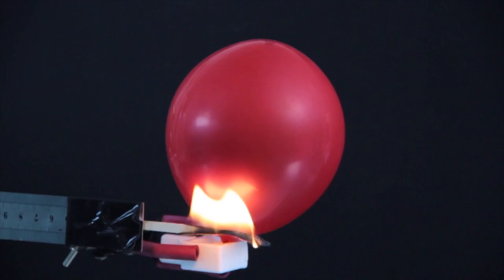Hi, I'm Steph and I'm going to show you how to make water explode. This is the best demo in the entire world. It's electrolysis, and the reason it's brilliant is because it takes something unbelievably dull and boring and ordinary — water — and makes it do something absolutely extraordinary.